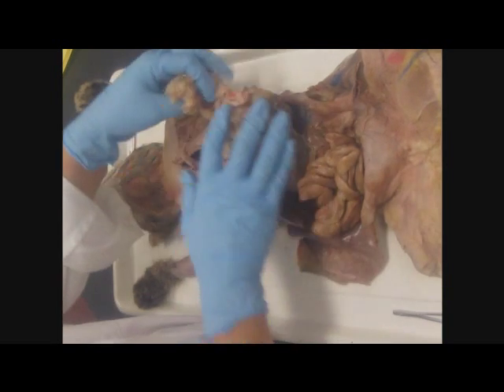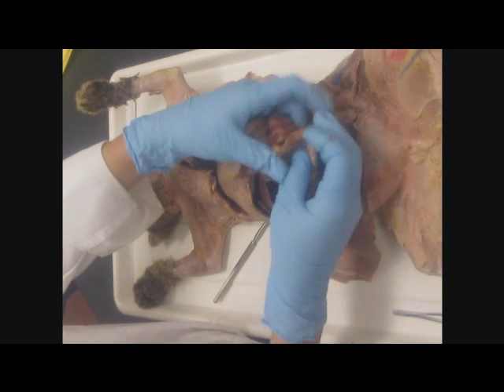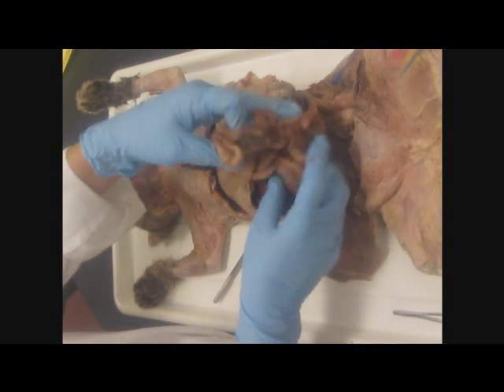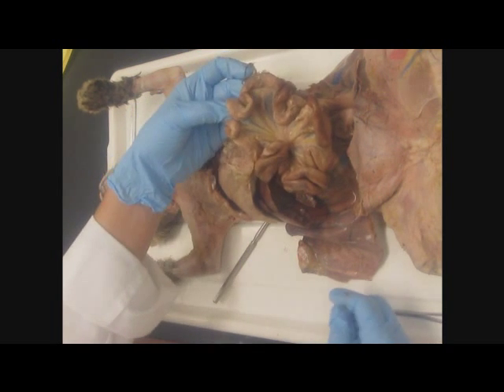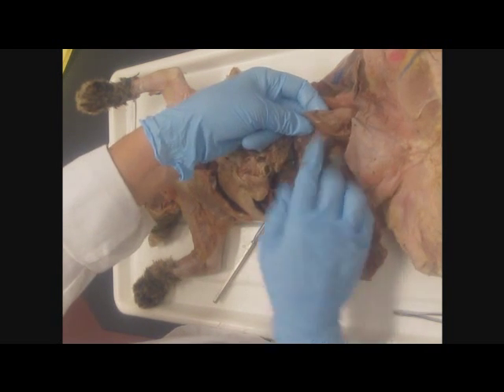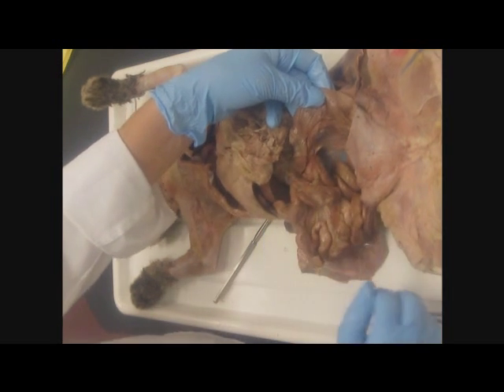Then we have mesentery. These are the small intestines, and if you just kind of gently unravel them and open them up, you can see that these membranous structures are holding that intestine to the back of the body wall, mesentery. Then you find the colon, which is along the back of the body wall here, and if you lift that up, you have mesocolon. You can see my finger behind there. Okay, and that's tethering the colon to the back of the body wall, mesocolon.